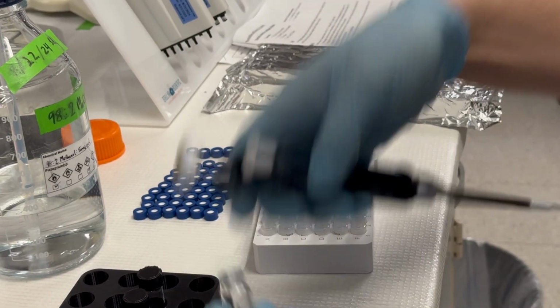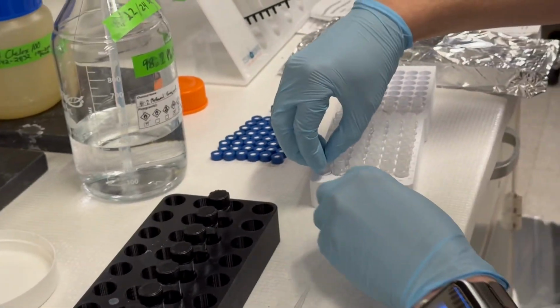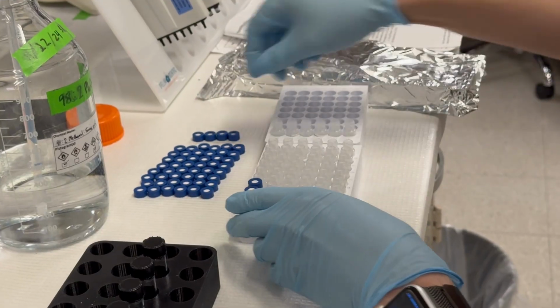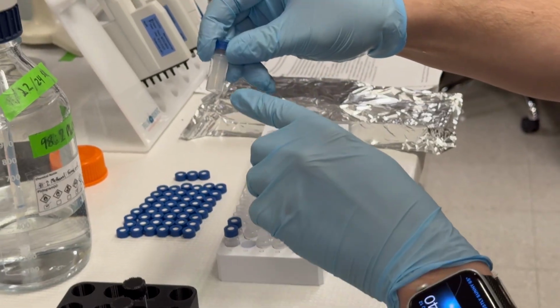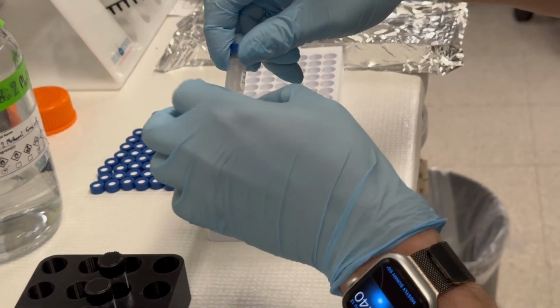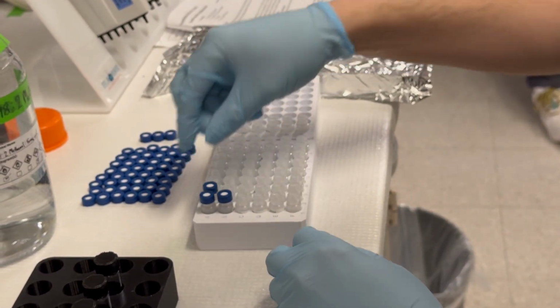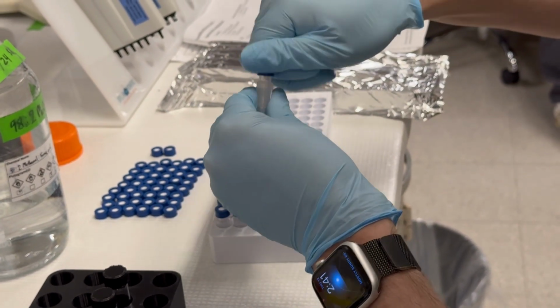Okay, and at this point, we've done 2 rows, so I'm going to start putting some caps on, partly so that they don't evaporate, but also so I can tell where we're at in the rack, because the first couple rows are easy, but once you get into it, it's tricky to keep track of where you are. One other thing to keep in mind with these insert vials: sometimes you'll get a little bubble at the bottom, like this big bubble right here, so it's good to flick it. When we inject this on the system, the needle goes down into the vial, and if it hits that air bubble, it's not going to get an accurate injection.